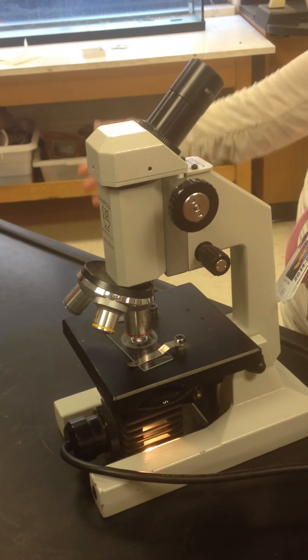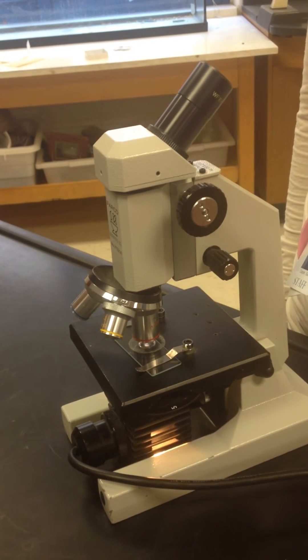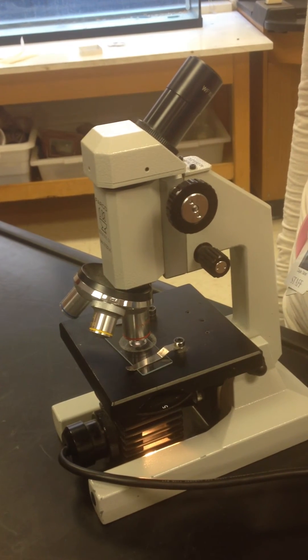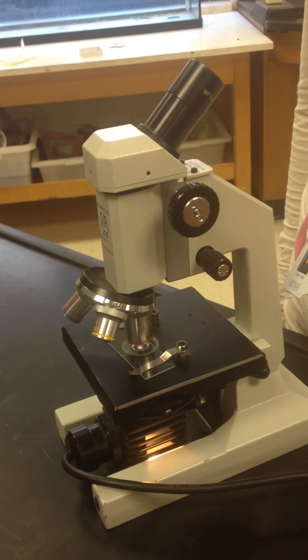And then you remove your hands from the microscope. Notice the coarse adjustment was never touched after the scanning objective was turned off.